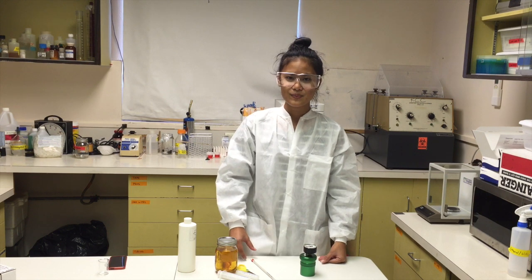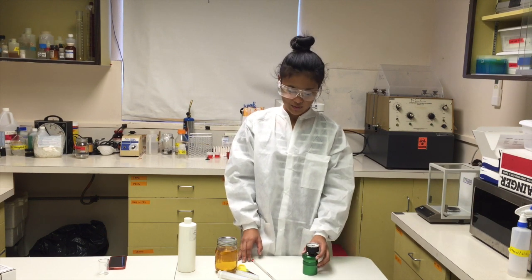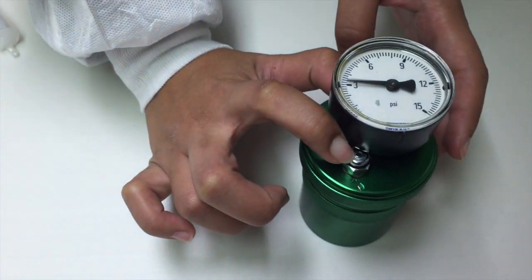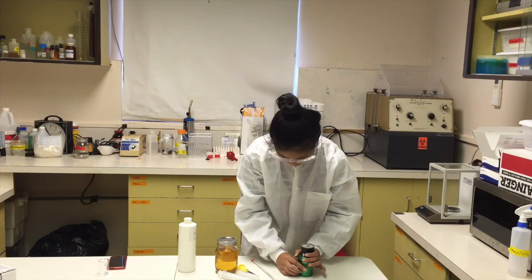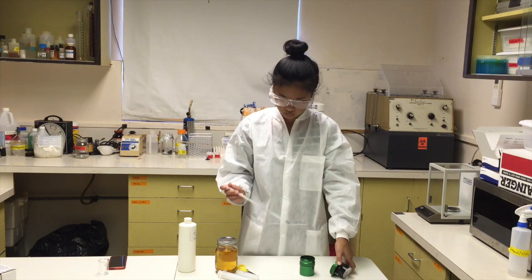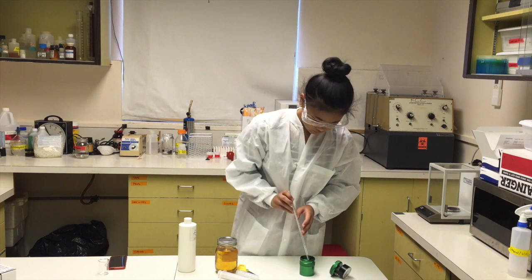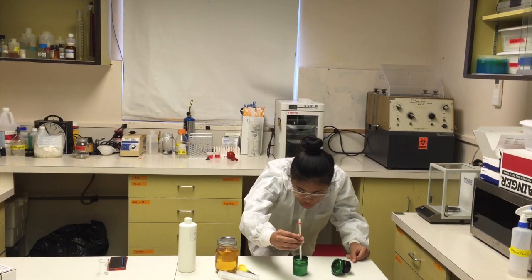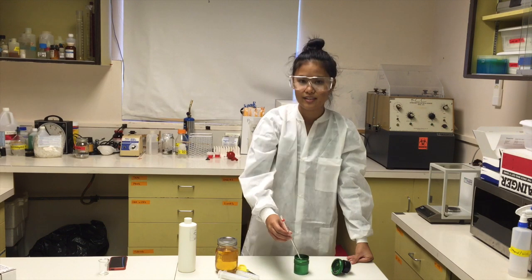After 15 minutes, we're going to take the temperature of the suspension and release the pressure. After 15 minutes, we got a temperature of about 29.0 degrees Celsius.